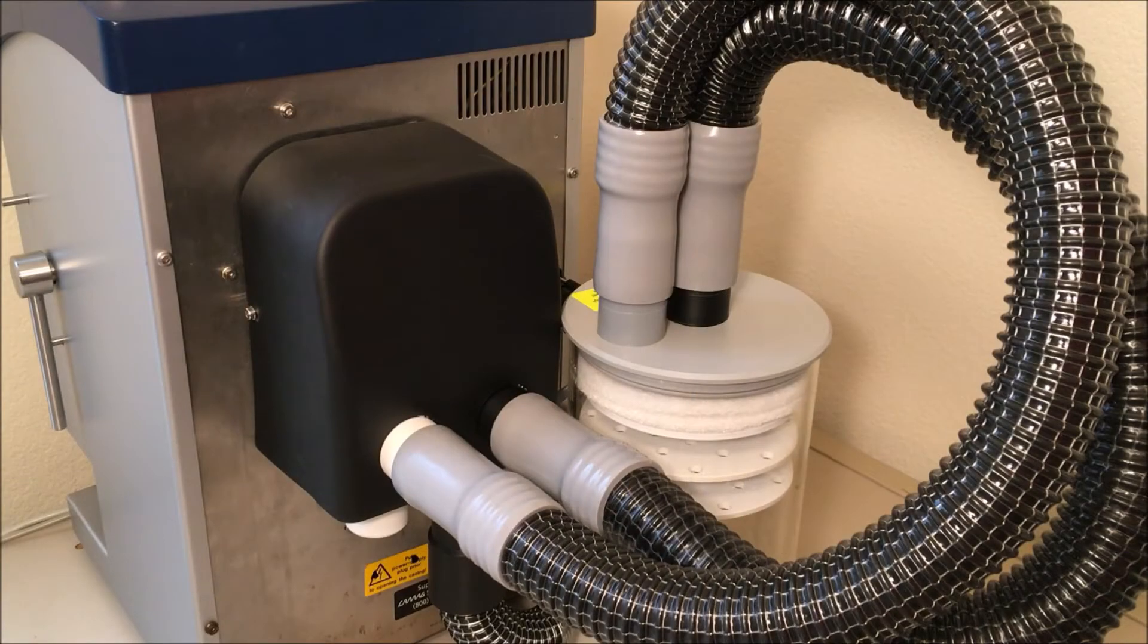To connect the humidity control unit to the container with the magnesium chloride solution, you will need to use two hoses.